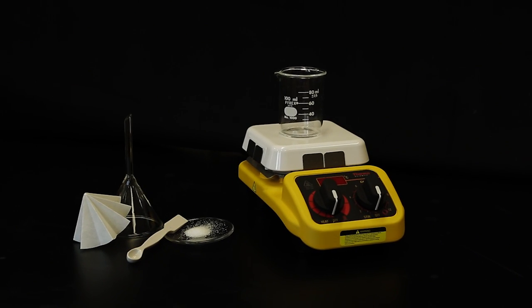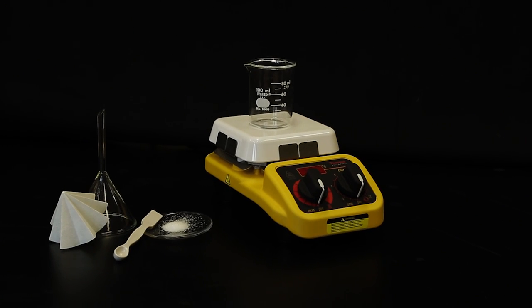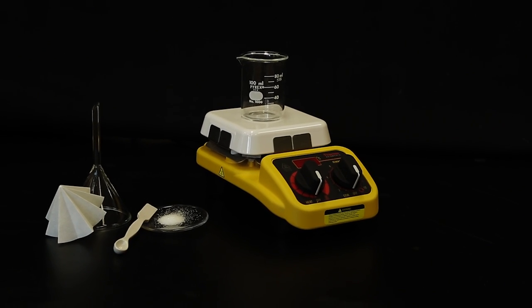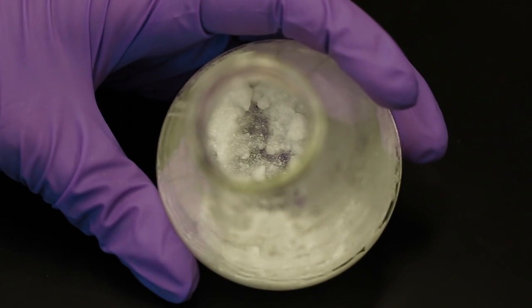Recrystallization is a method used to purify organic materials from impurities. This technique video shows how to recrystallize acetylsalicylic acid that contains salicylamide impurities.